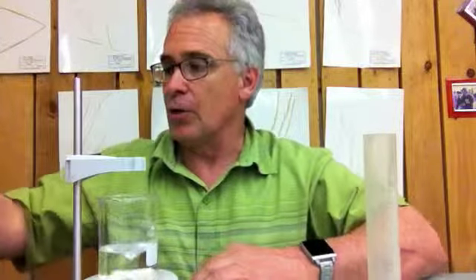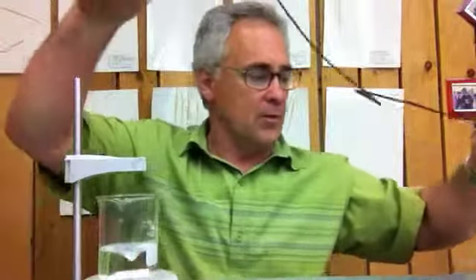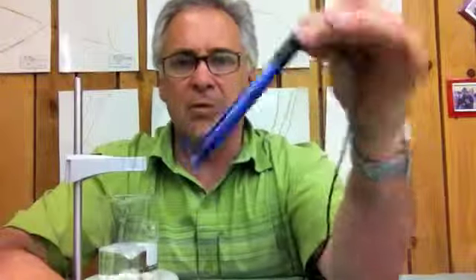Well, remember we talked about buffers really resisting changes in pH, because pH is really important as far as the cells taking in or not taking in certain kinds of elements or nutrition. So we're going to need to measure the pH. We're going to be using this Pasco pH probe, a digital probe, and the amplifier box.